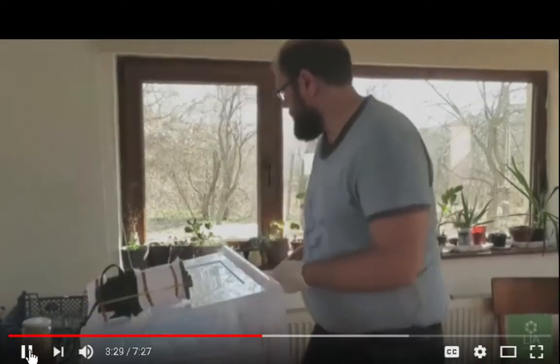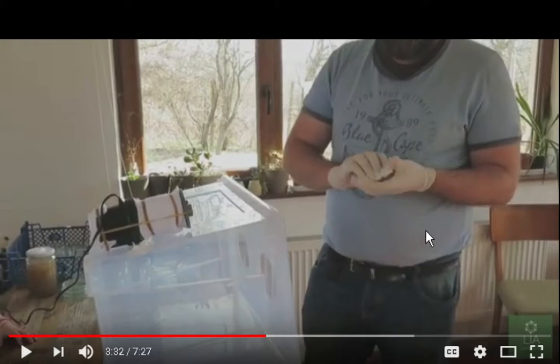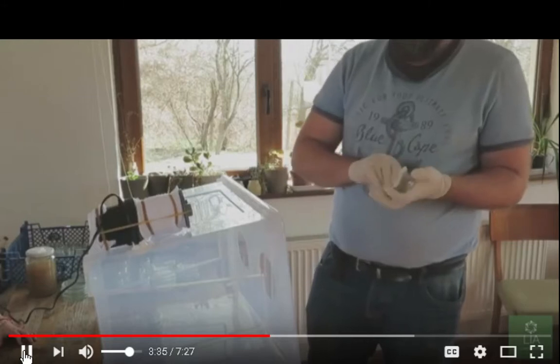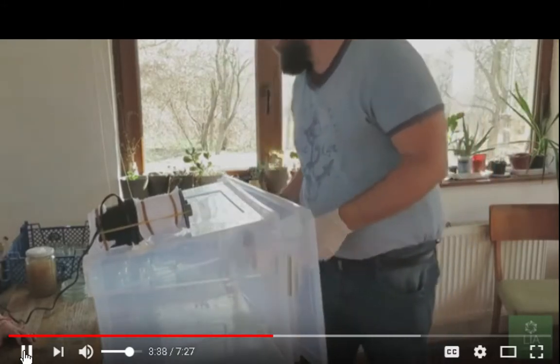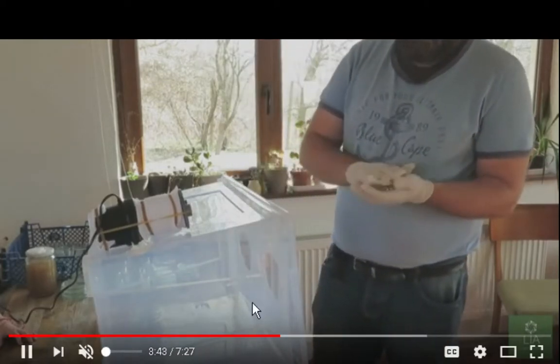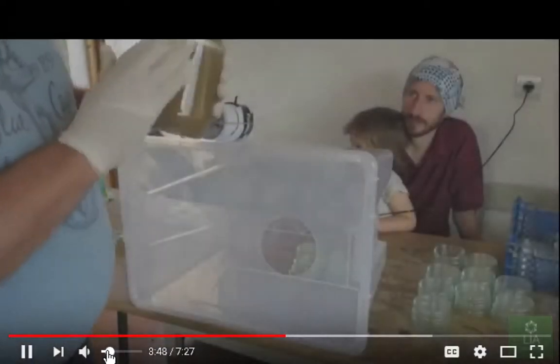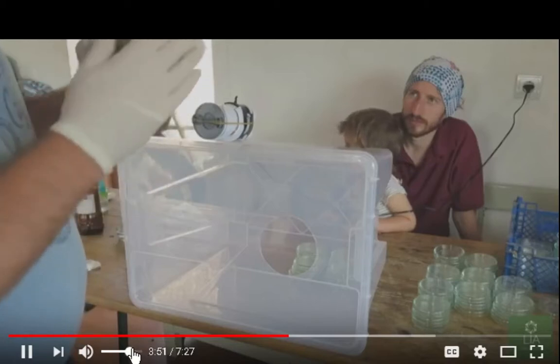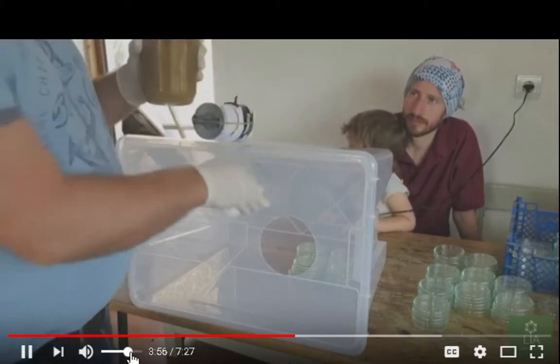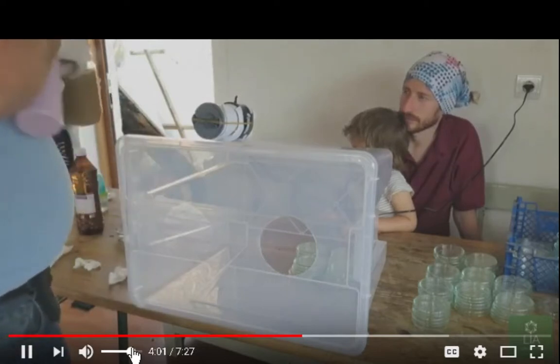So what he's doing now, he's wiping his dishes out here and then putting them inside, I guess. I don't see any problem with that. That kind of eliminates the purpose of having the holes here to begin with, but he's doing his transfer inside, of course, later. That we just made, and we're going to clean this also with the alcohol, just to make sure that everything that goes in there is clean. Okay, goes the alcohol swab down on the floor.